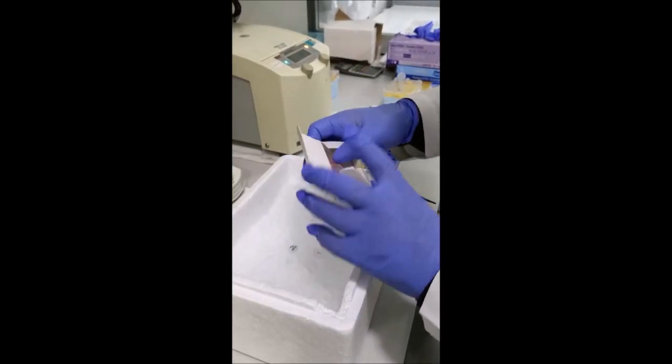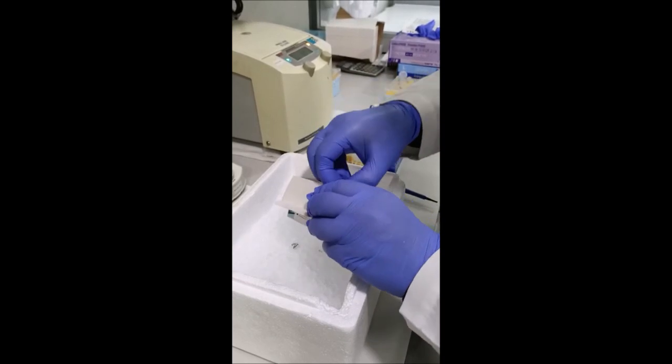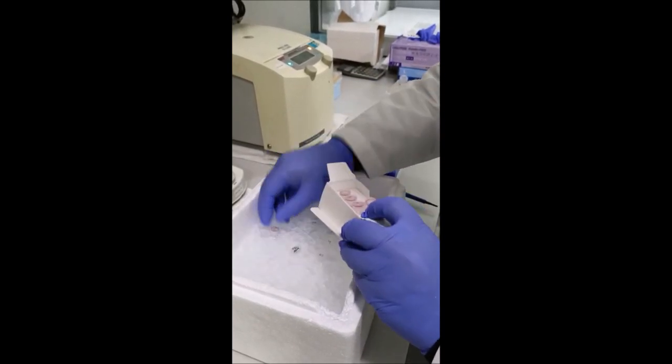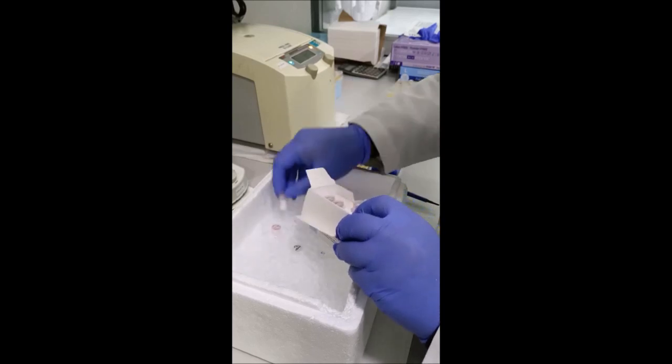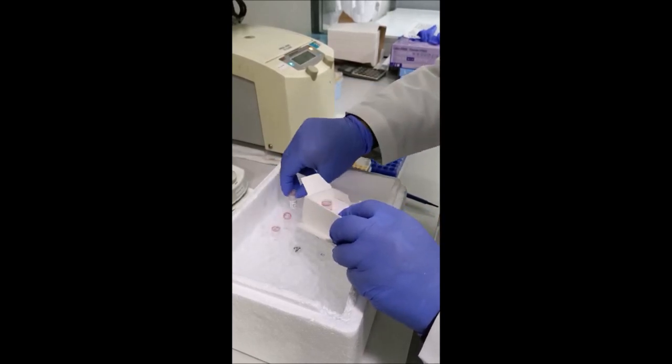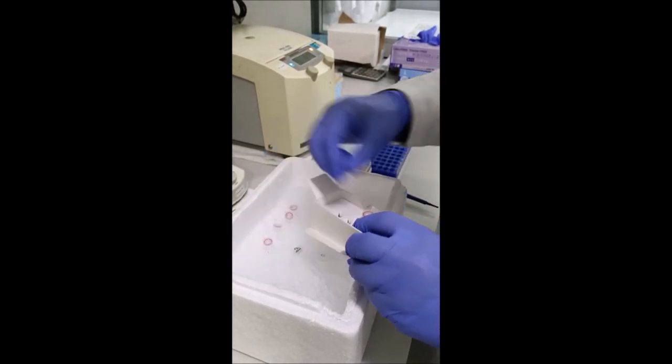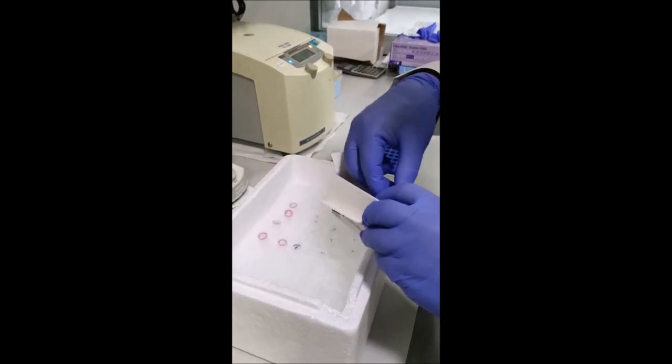This is our QPCR kit box. We are working on ice, putting the kit and the ingredients onto ice.